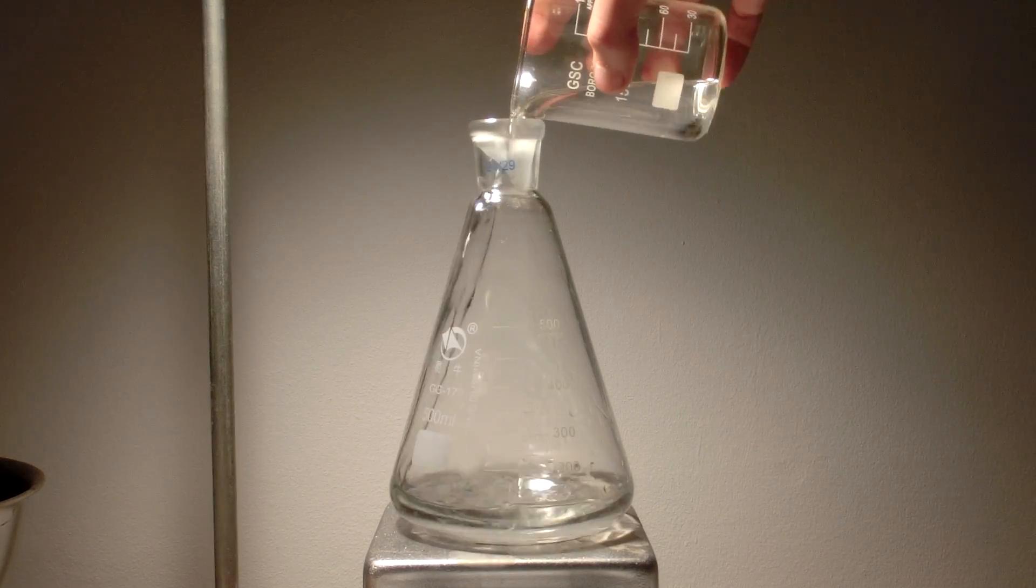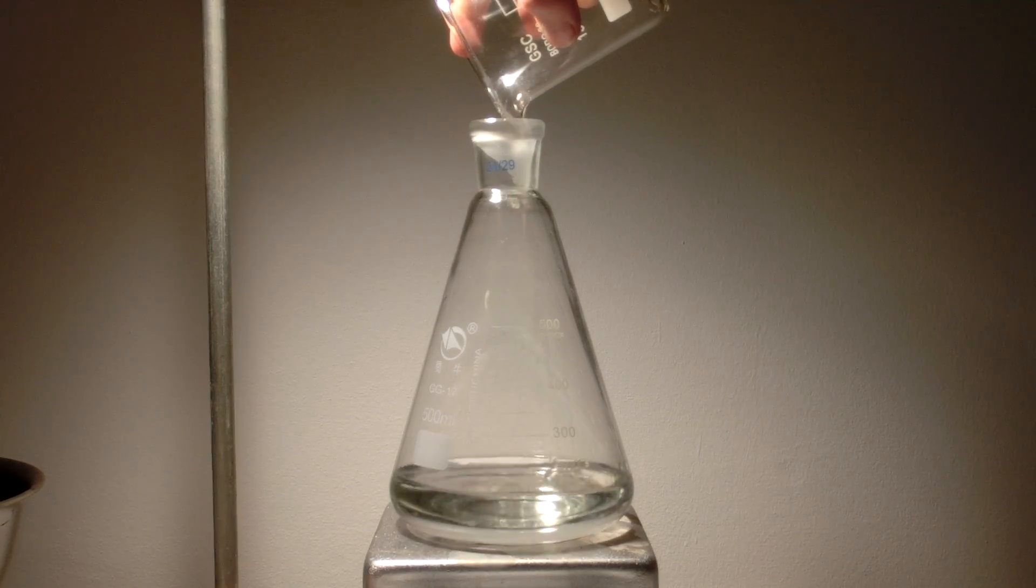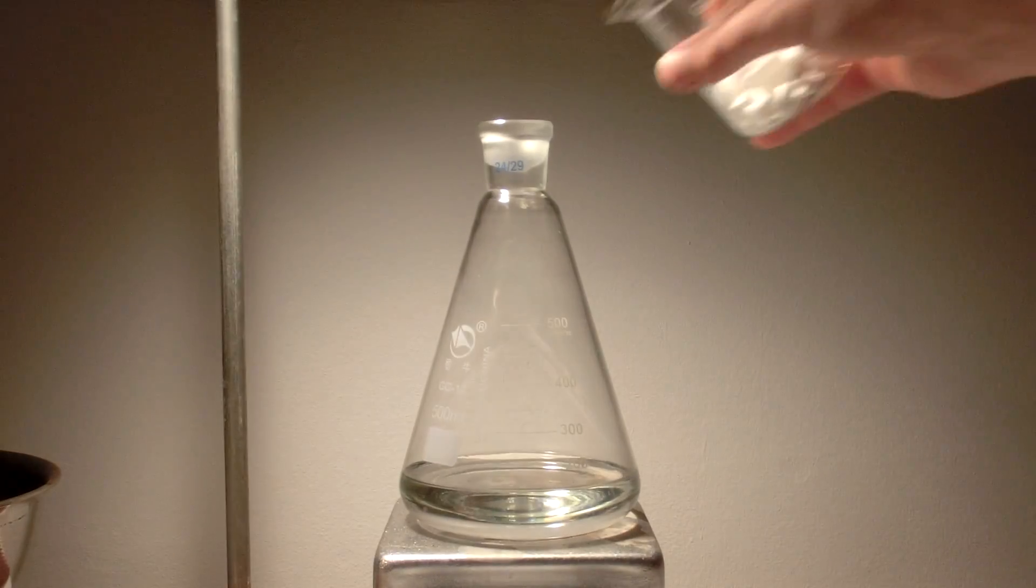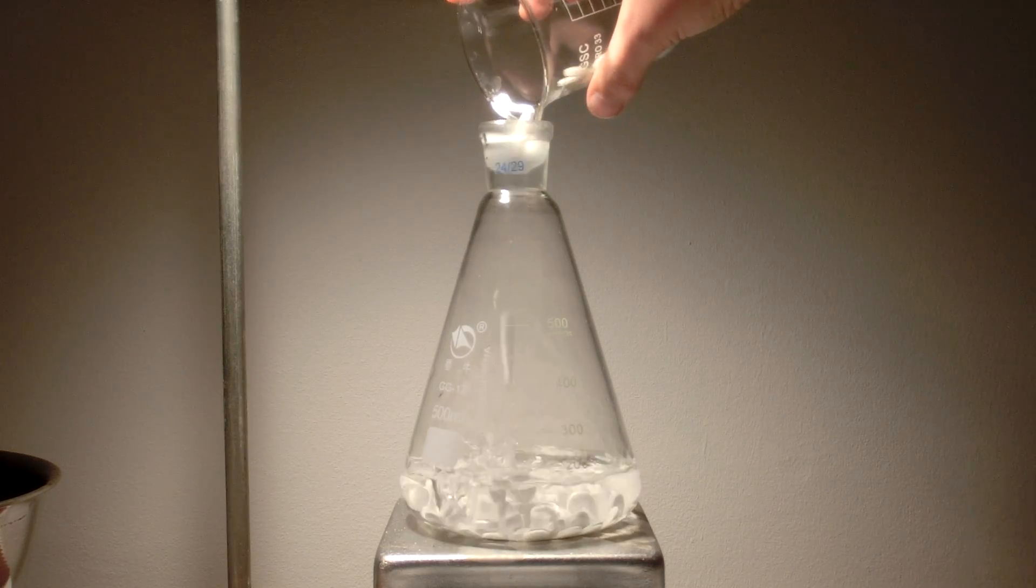First, measure out 150 milliliters of isopropyl alcohol. Then, add 100 aspirin tablets.